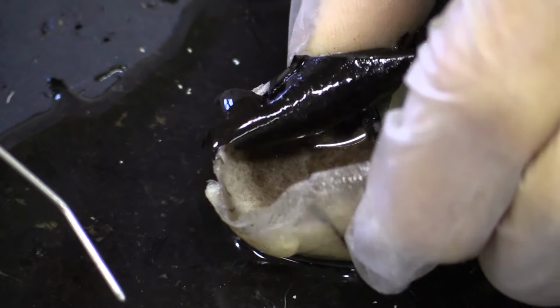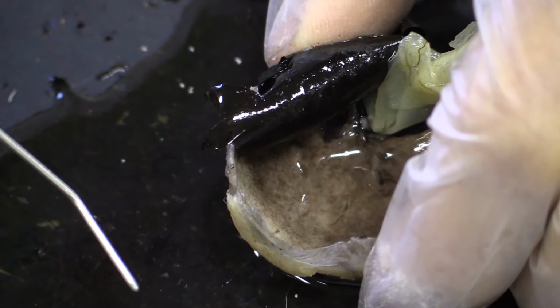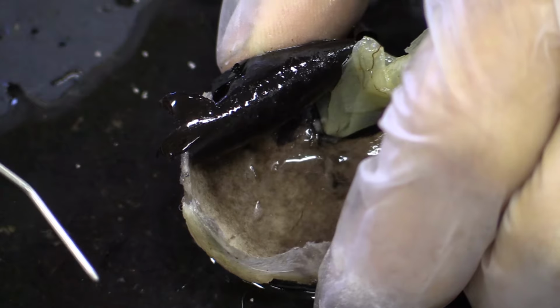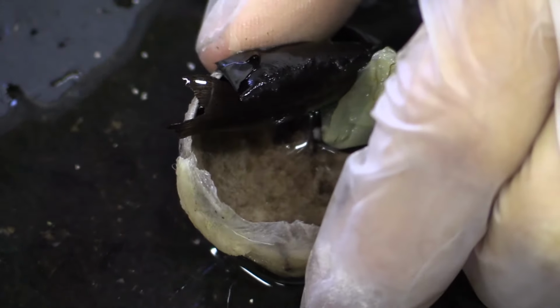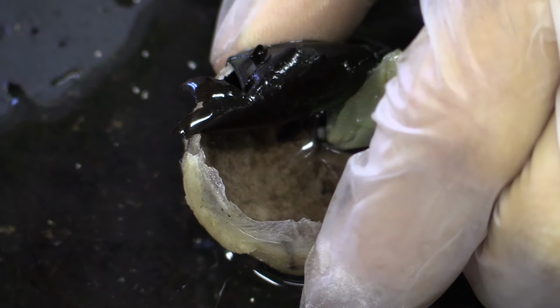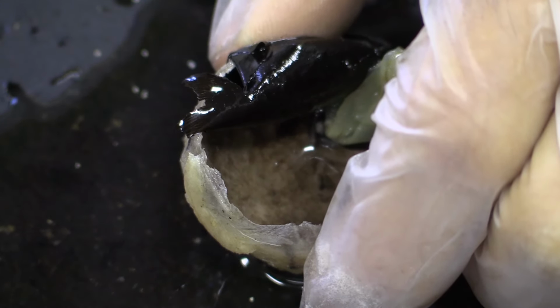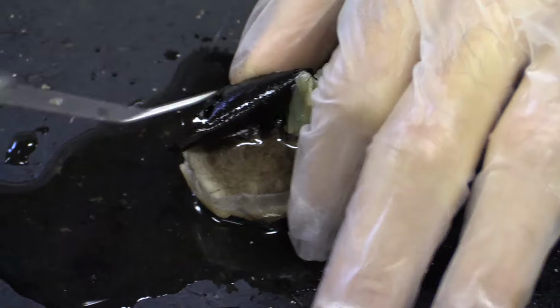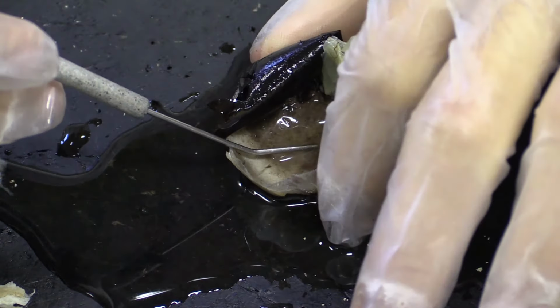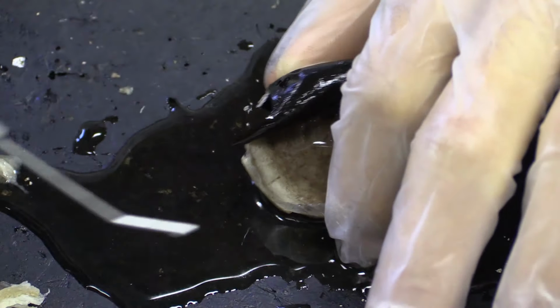If you look carefully, when I squeeze, it goes straight back to its original form, which suggests it's made out of a fibrous material, and it's very important for the eye to retain that round, almost spherical shape, and hence allows light to be consistently refracted and transmitted at a consistent angle. Right now, I'm going to move this, and we're done with the posterior 5/6. We're going to go to the anterior 1/6 of the eye.